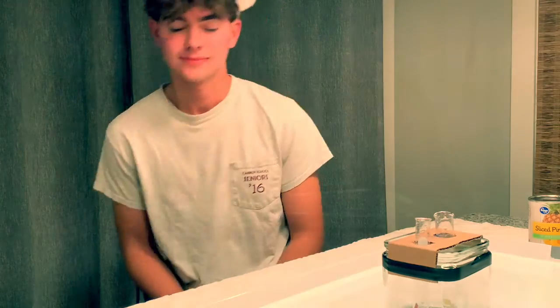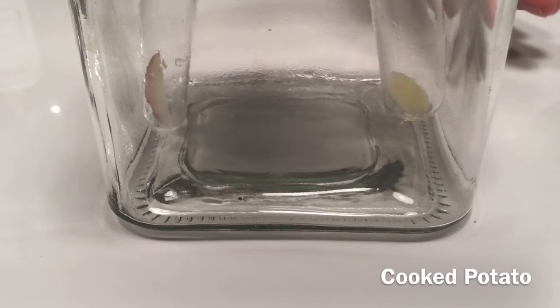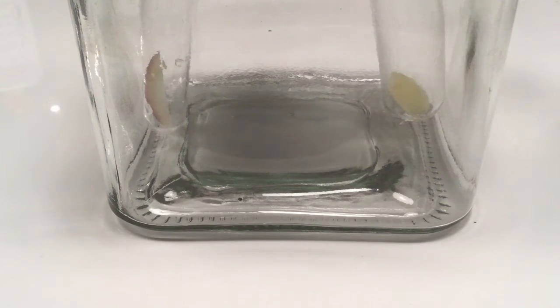For my first experiment, we'll be doing catalase. On the one side, we have a raw potato, and on the other side, we have a cooked potato. We'll be adding hydrogen peroxide because it's naturally formed in living organisms. However, it's very harmful, but it includes enzymes including catalase. This enzyme catalyzes the breakdown of hydrogen peroxide to water and oxygen.